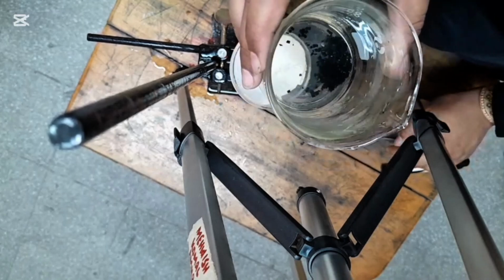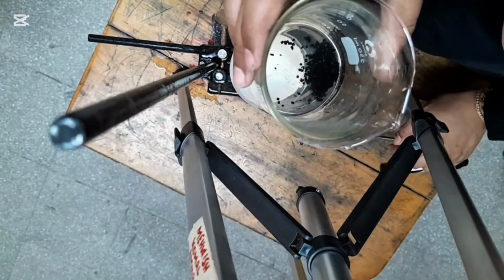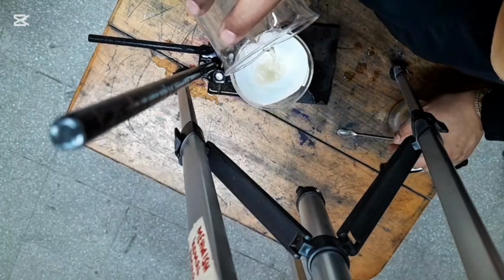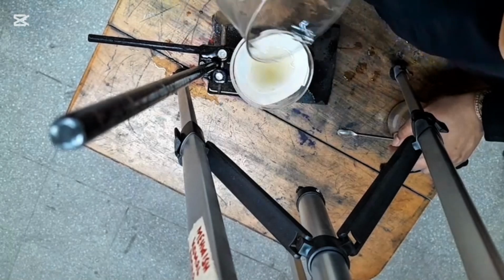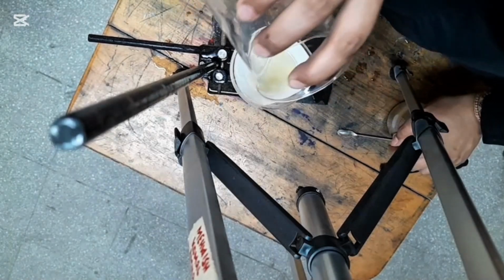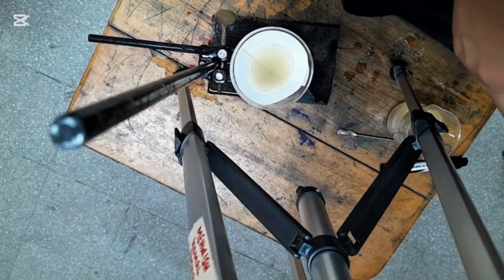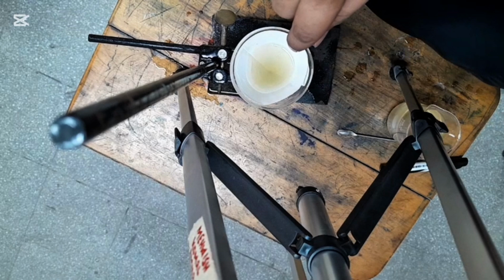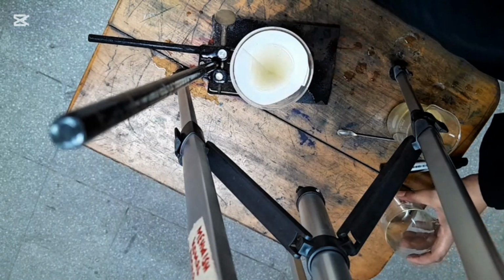After some time you can see that these particles are not getting mixed with the water; they settle down at the bottom of the beaker. When I filter this solution, you can see that the sand particles settle down on the filter paper. So wait for the filtration process of this suspension. We will observe the results after the filtration of this water.